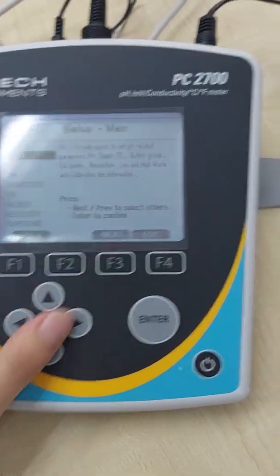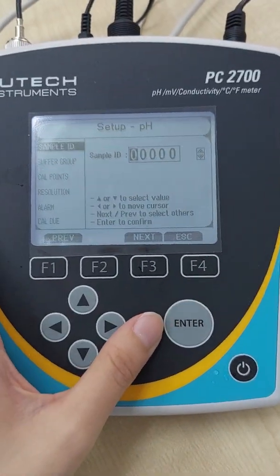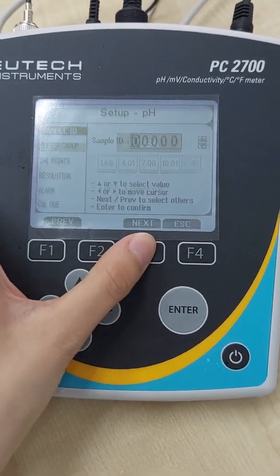Then I'll show you the pH setting. So let's skip this.